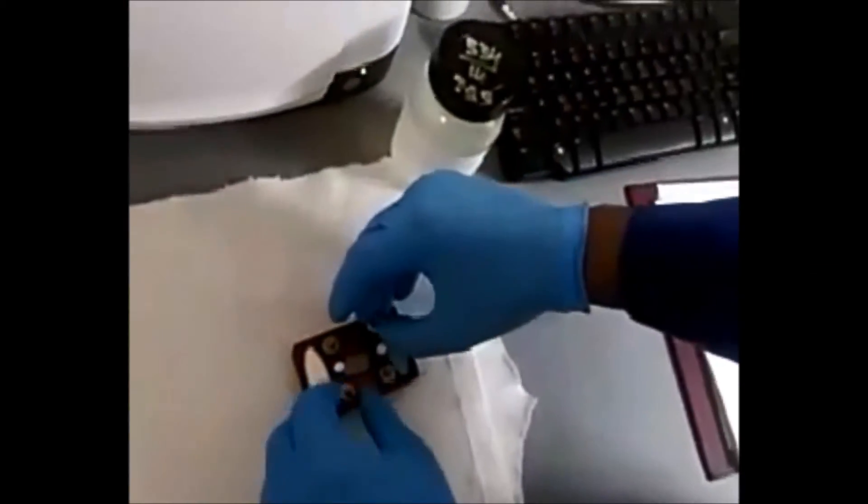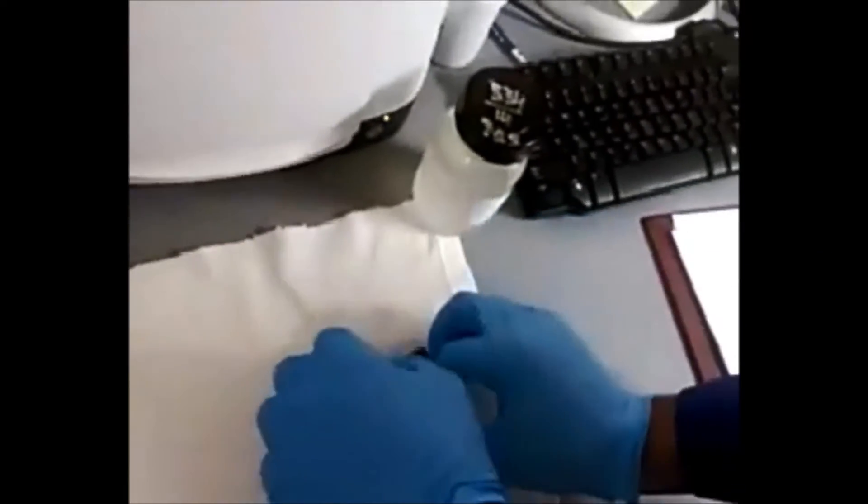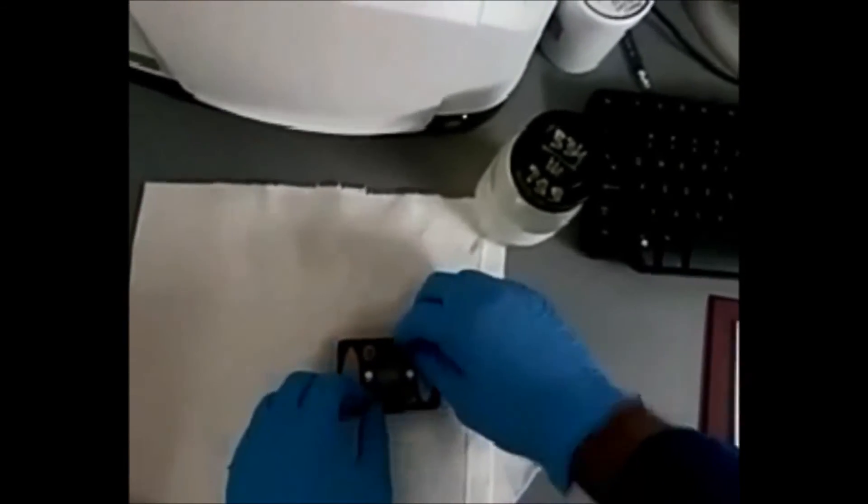Then you place your cover slide on top of your slide. And this is used to close. What I do is I'll place the screws diagonally. This ensures proper closing of the cover. It shouldn't be too tight, it shouldn't be too loose, because you want a decent parallel straight line—a fixed path length, as we call it. And this is ready.